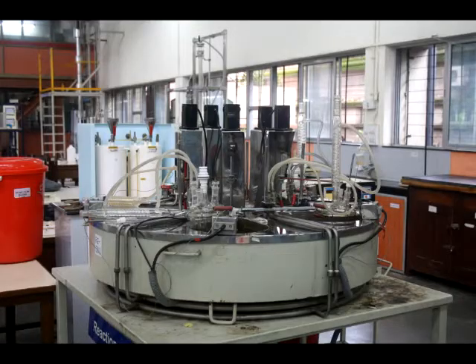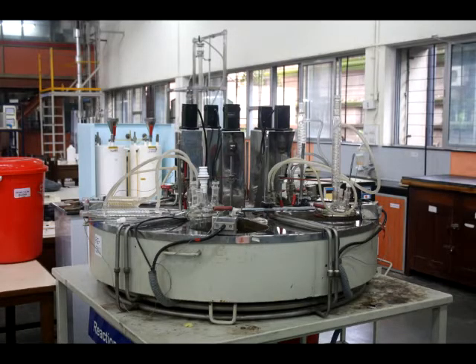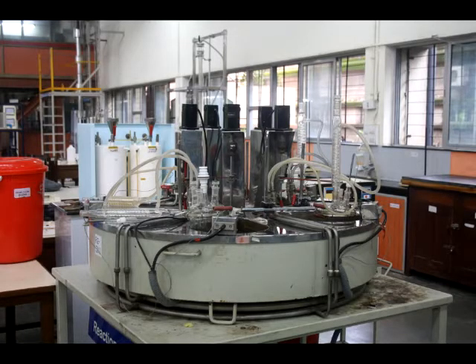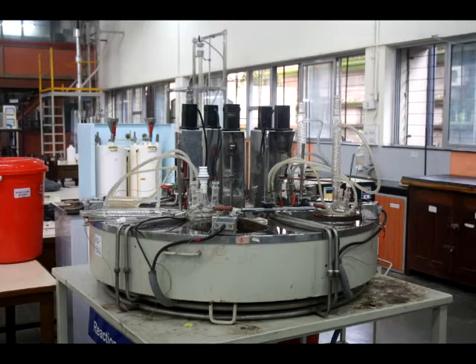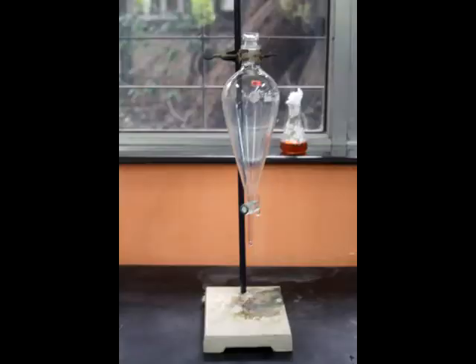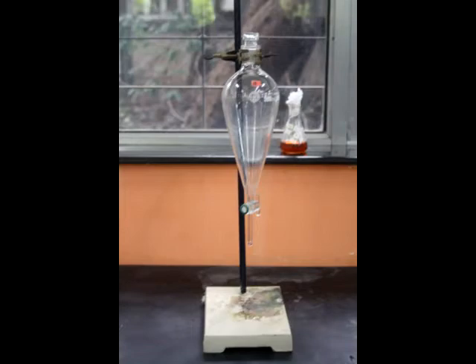Initially, we convert fatty acids to biodiesel by reacting them with methanol in the presence of sulfuric acid as catalyst. This step is called esterification. After esterification, we transfer the contents of the reactor to a settling funnel.